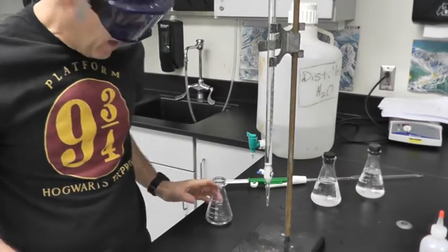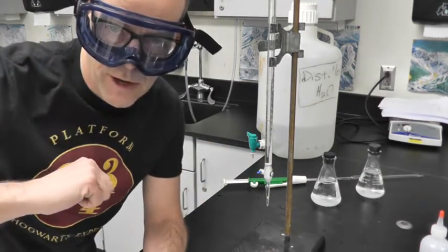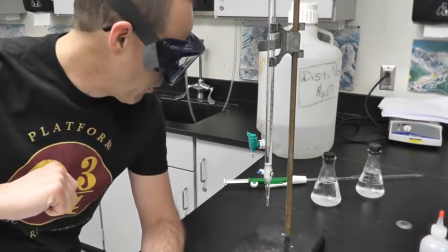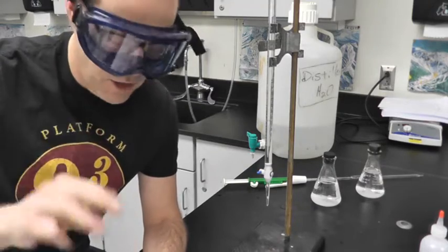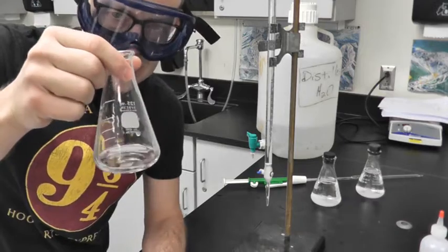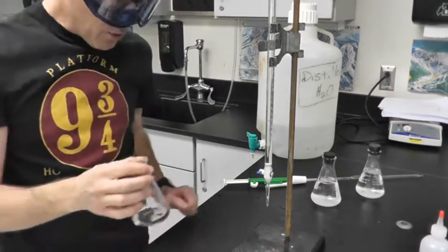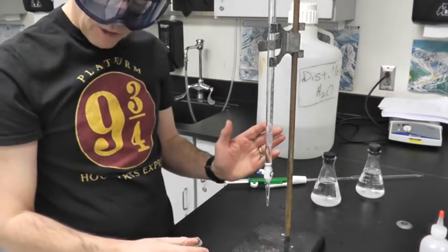All right, so the battery died, which is why the video stopped. I have since run 2 unsuccessful titrations, which is fantastic. Tried to record those. So hopefully third time is the charm. So when the battery died, I was in the midst of adding 10 milliliters of saturated calcium iodate solution. So this is what I'm going to titrate with my sodium thiosulfate.